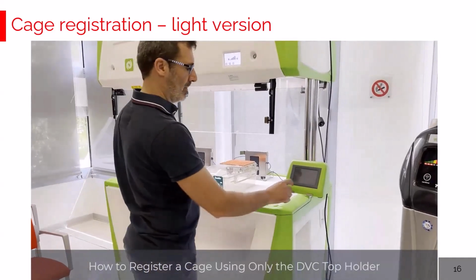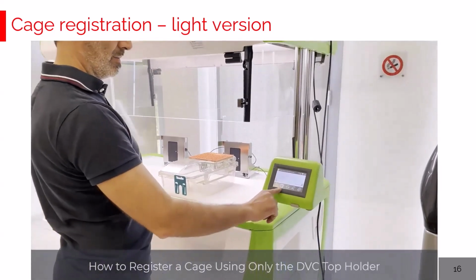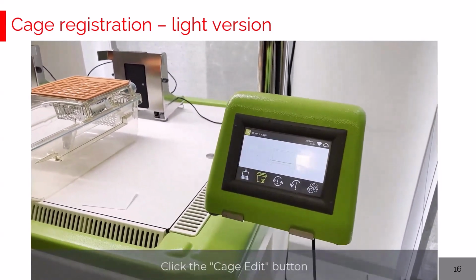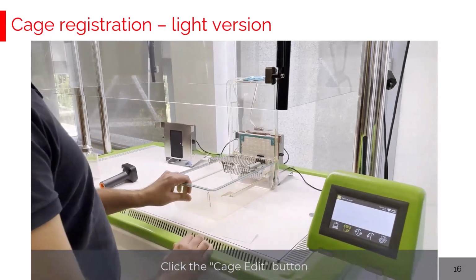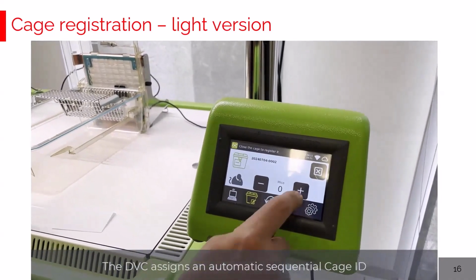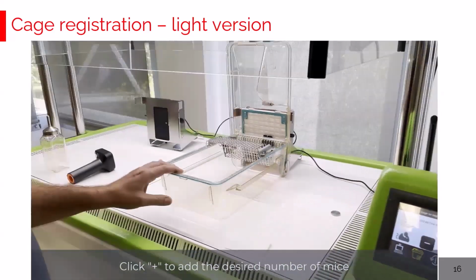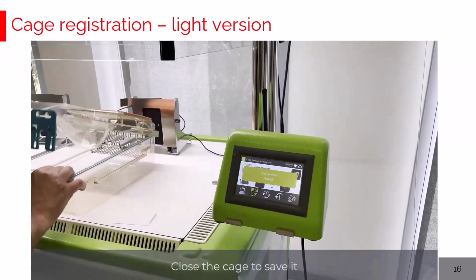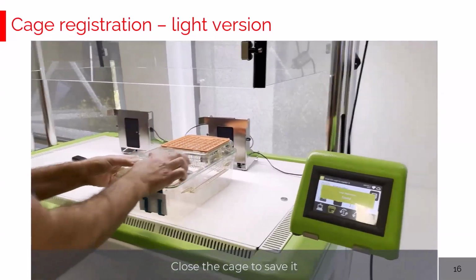Now let's see a third, very basic but very fast way to register a cage. There is an opportunity just through the control panel by clicking the corresponding cage edit button to open the cage, and the system automatically assigns a sequential number provided by the DVC. You can simply add the number of mice into this cage that is going to be created, and simply by closing the cage, it has been saved with this DVC provided cage ID and 3 animals.